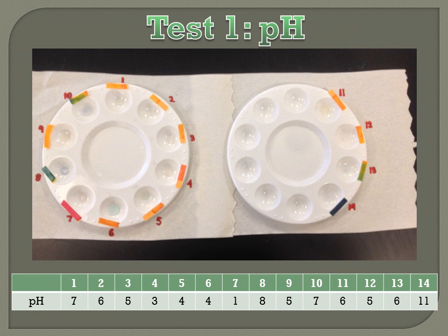The first test is determining the pH of each solution. This is done by dipping the tip of a litmus strip in each solution. The tip of the litmus strip will turn a specific color, which can then be matched with the corresponding color of a provided pH chart.